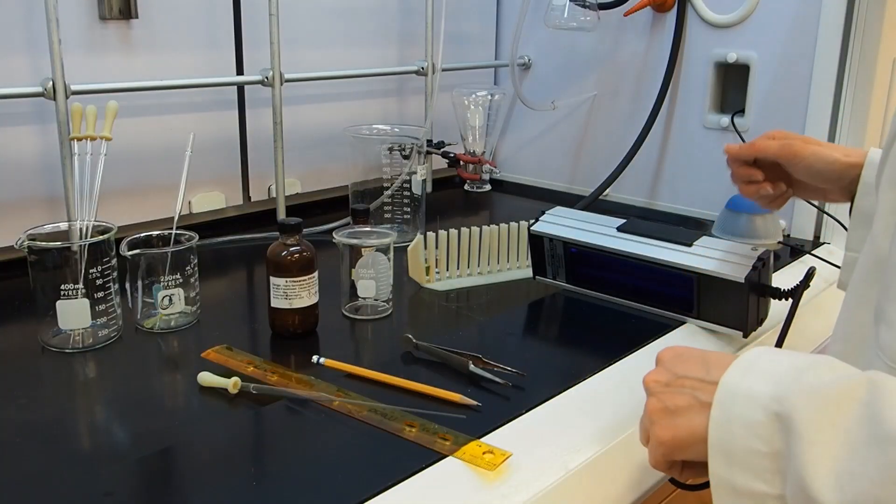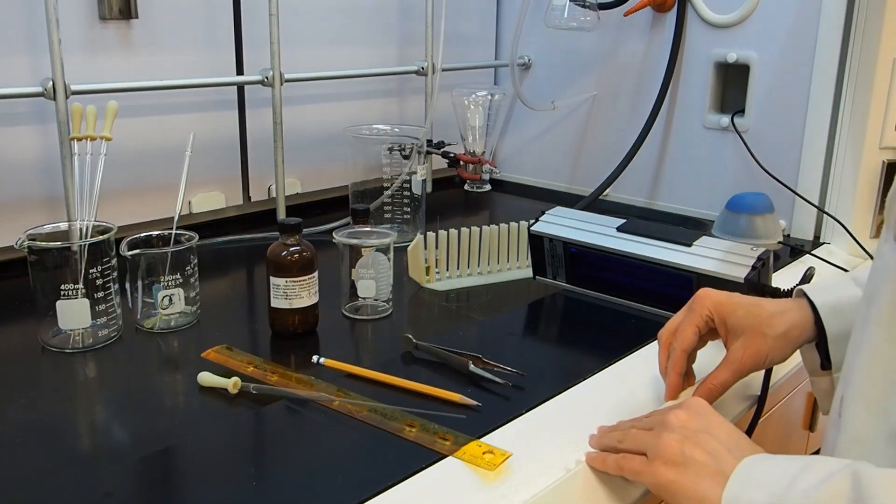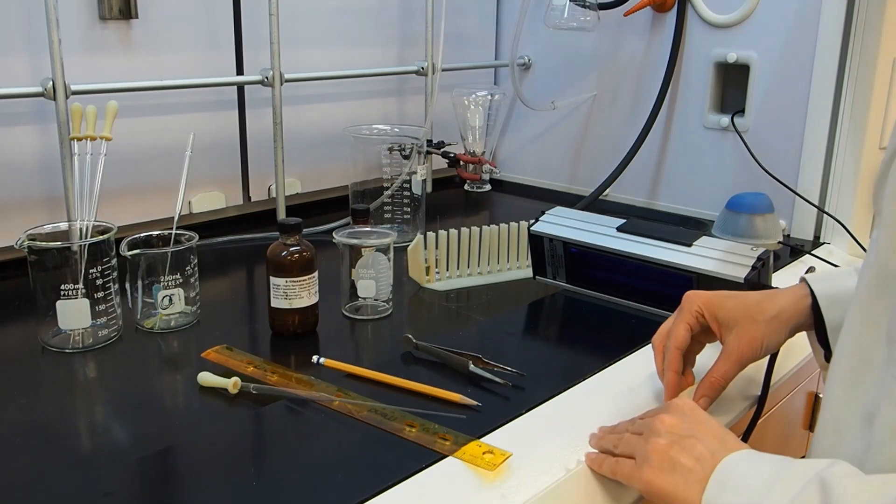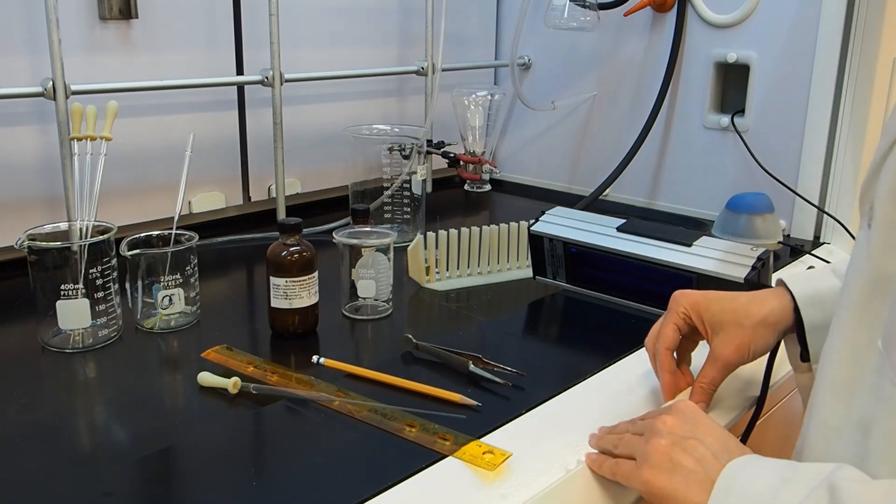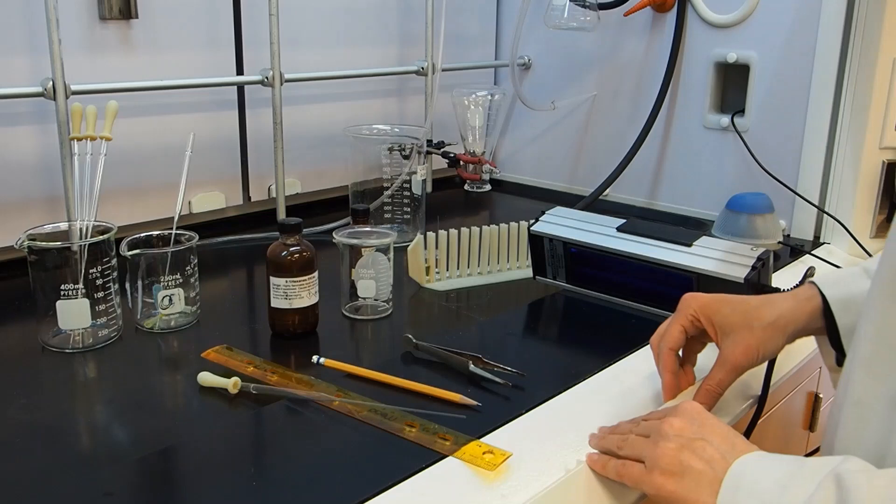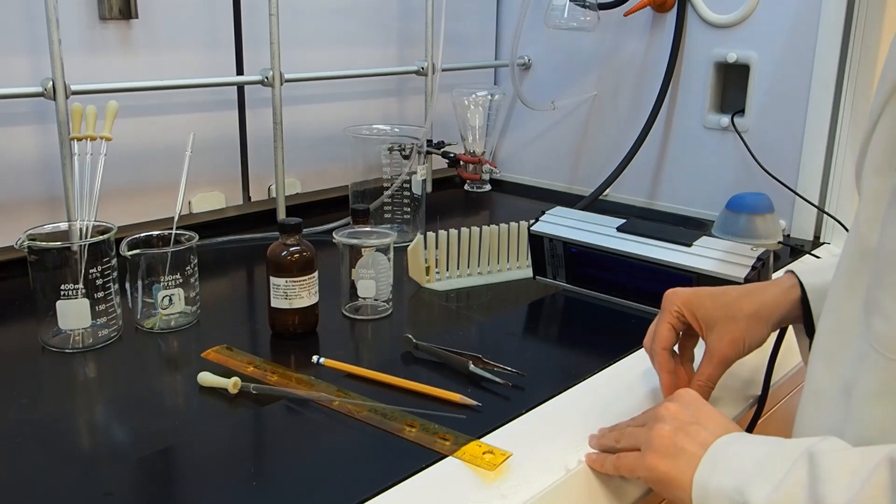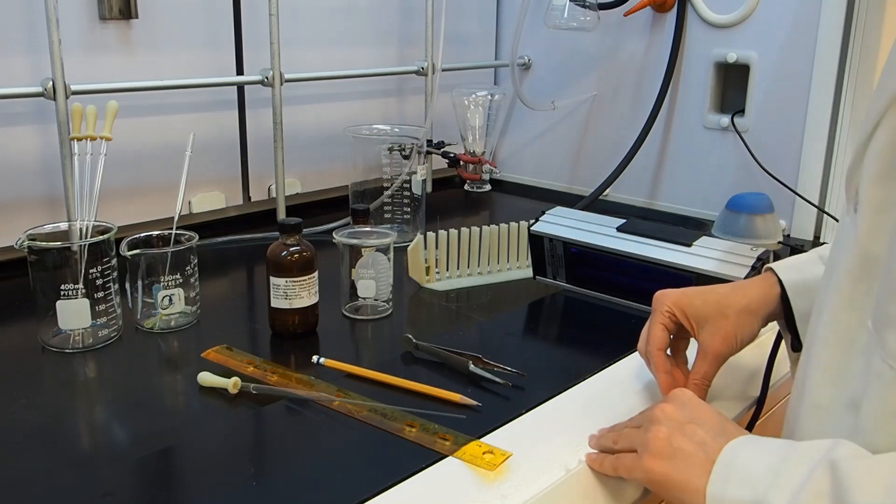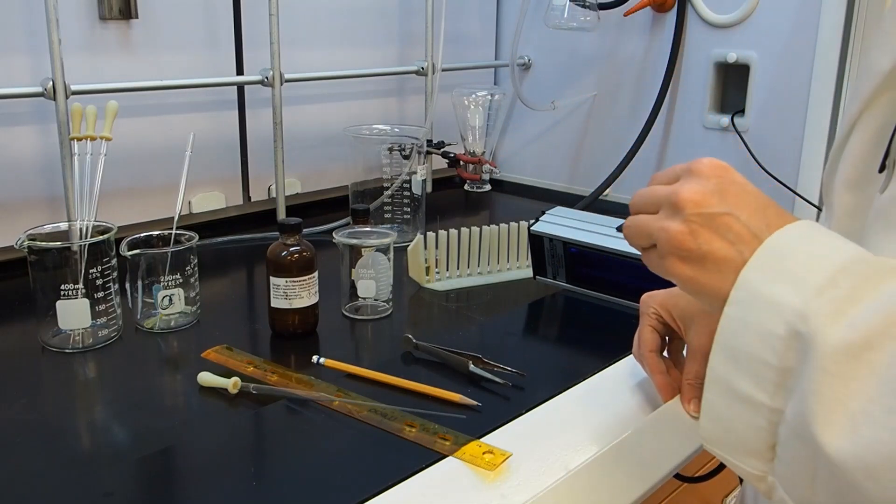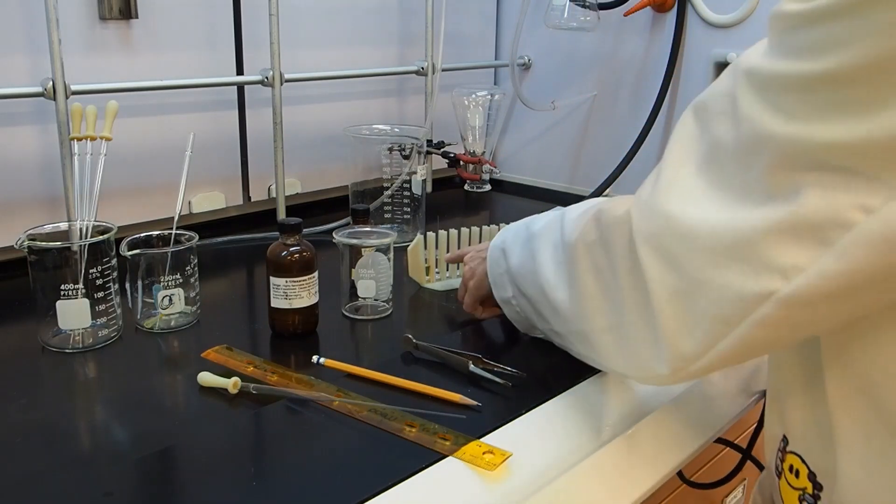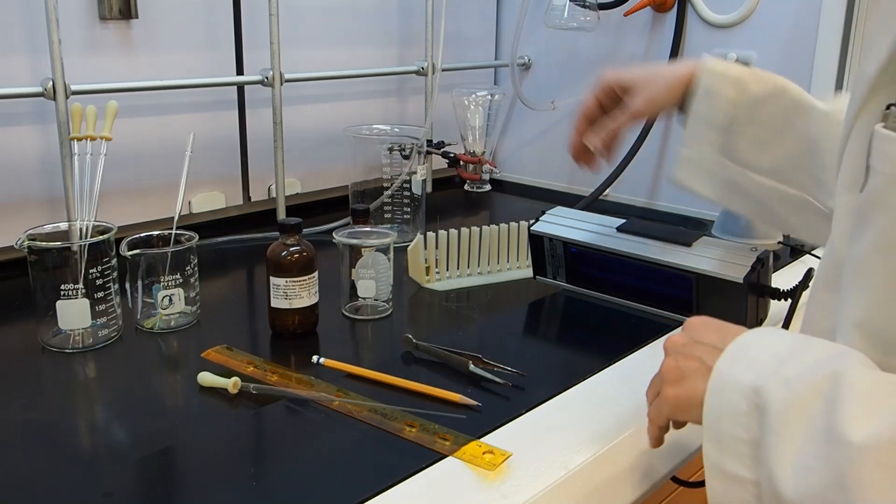The reaction can be monitored by TLC if you want to see if it's done after 45 minutes, or you can just wait until the full 60 minutes. If you want to TLC it, simply use a pipette to get a small drop of the reaction and place it in a vial. I have already done this off camera.